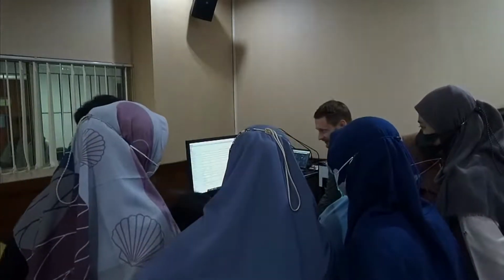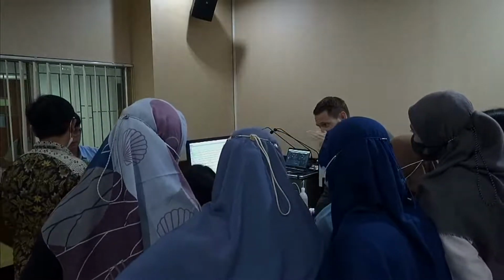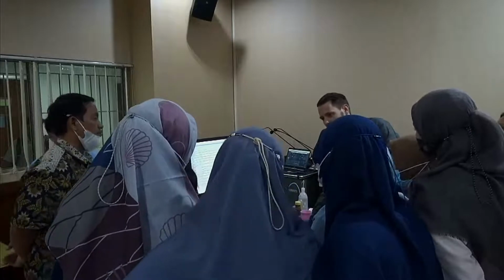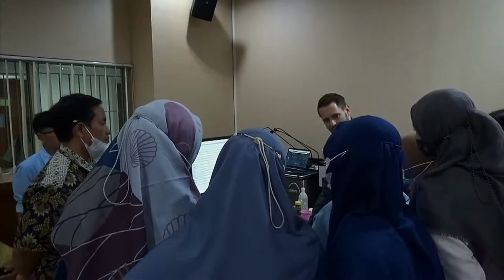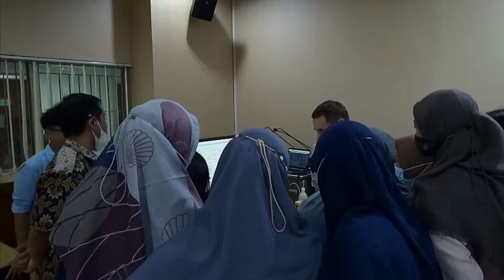We double click. The SOPs themselves are basically command based. So you just give the software a certain order of commands, which allows you also to freely program different procedures as you want them to be, which is actually for research, it's really a good system.